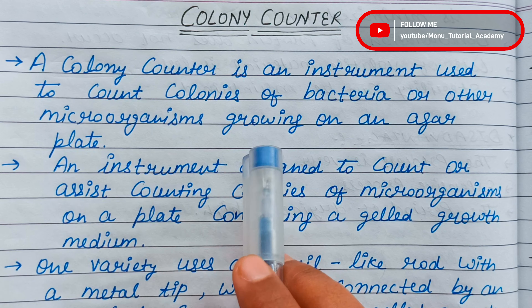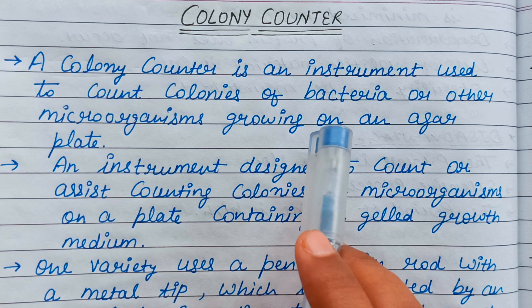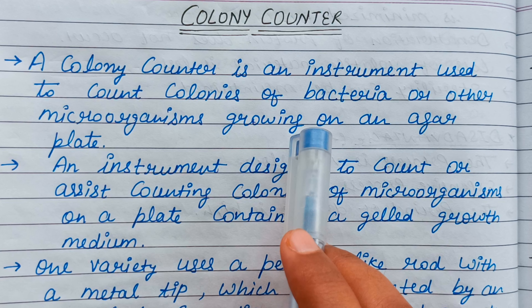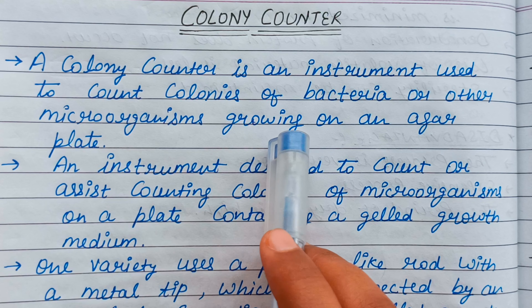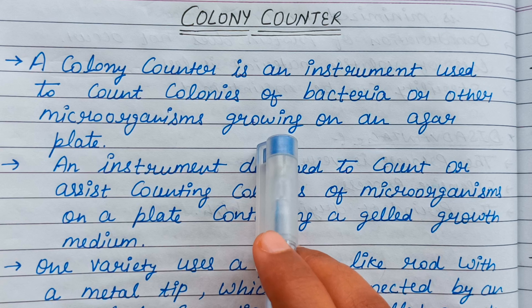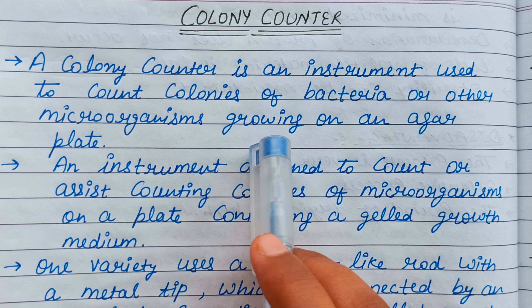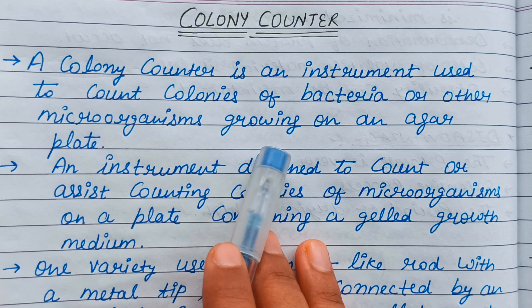Friends, manual counting was not very accurate because there was no automatic system. You had to count it yourself, and you could easily miss some colonies or miscount. So the automatic colony counter is very useful.